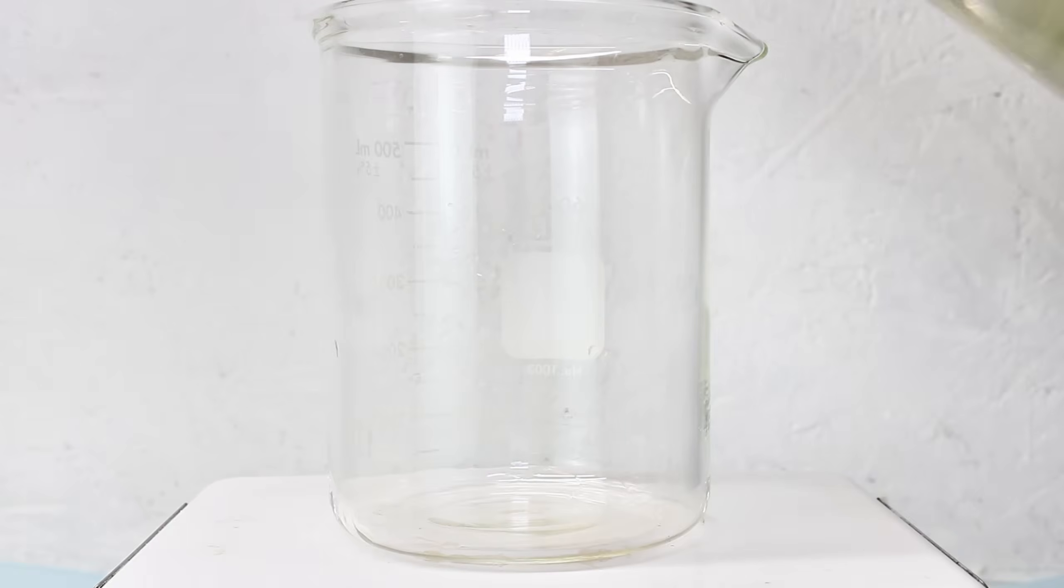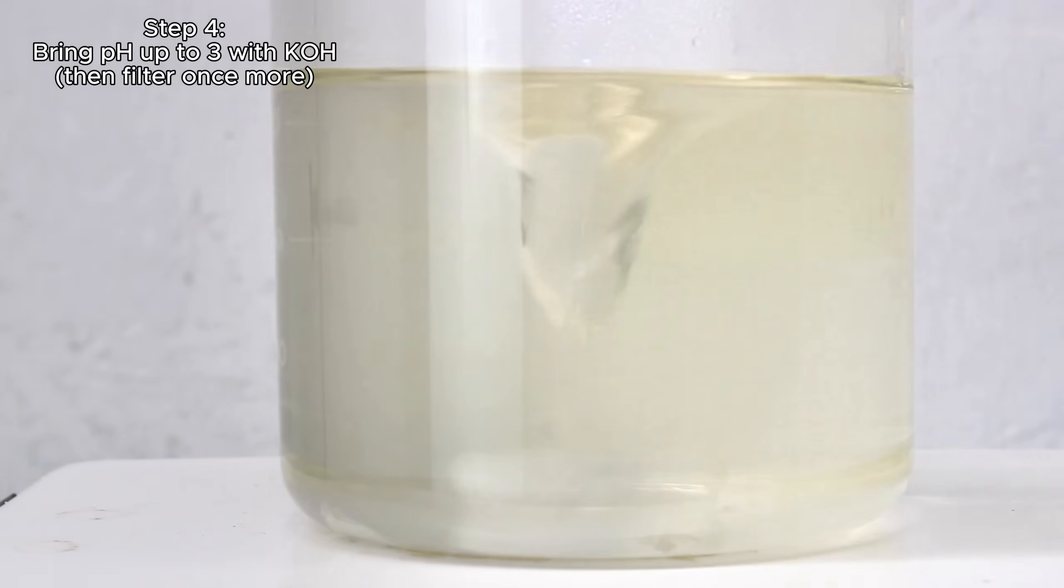Anyway, I next add some water and apply heat until the mass dissolves, and then I passed it through two layers of coffee filters twice, which did a shockingly good job of removing all the impurities from the aluminum foil.